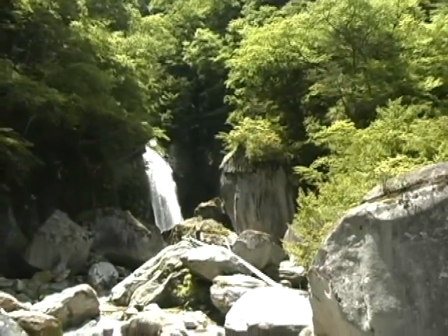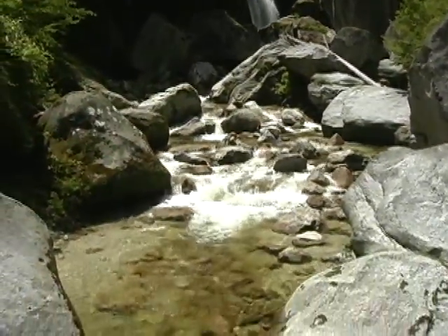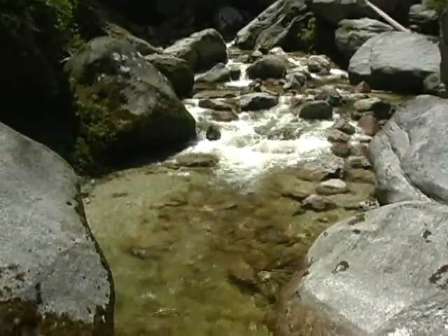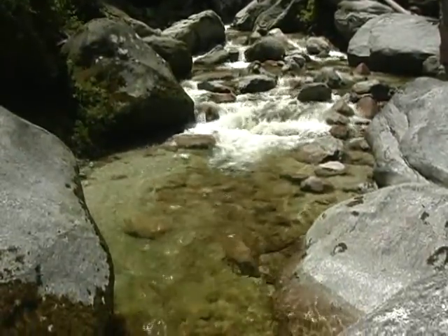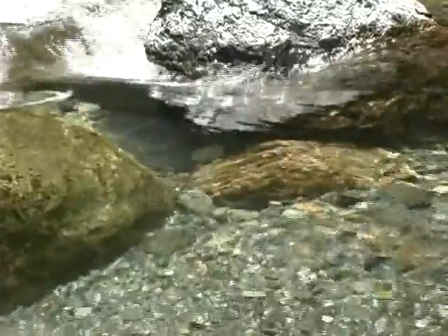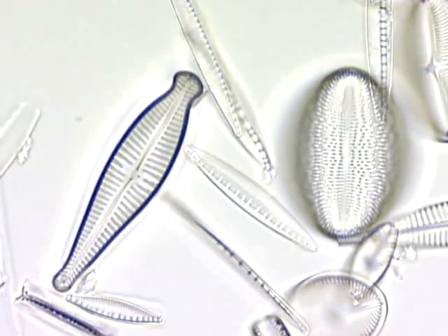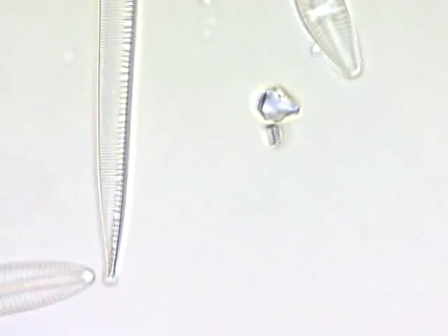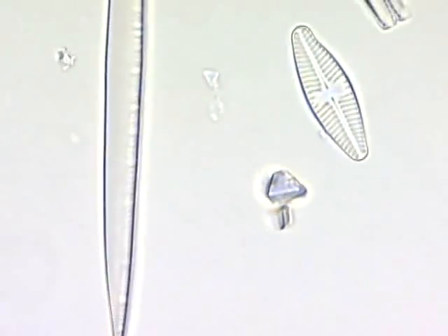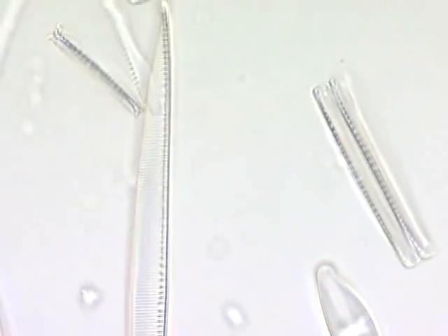This is a clean mountain stream. The water is very clear. Diatoms from the clean water sample come in a variety of shapes including oval, circular, and linear. In contrast, the severely polluted water contains fewer shapes.